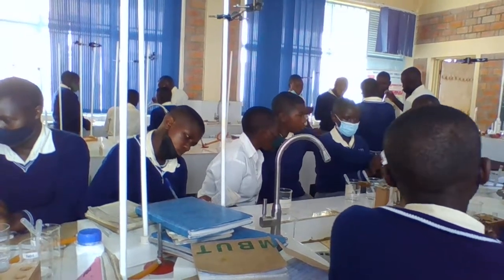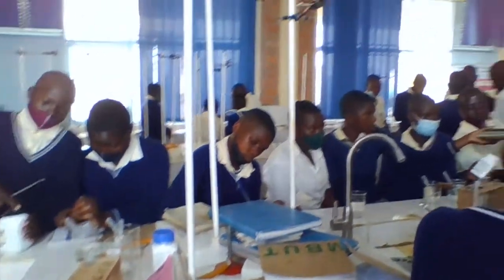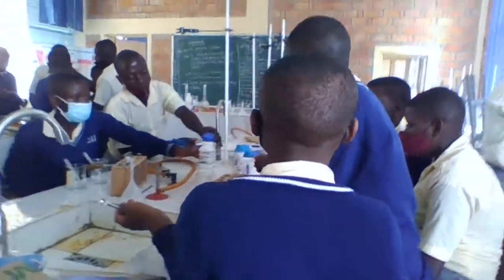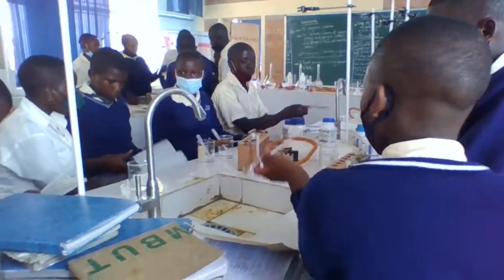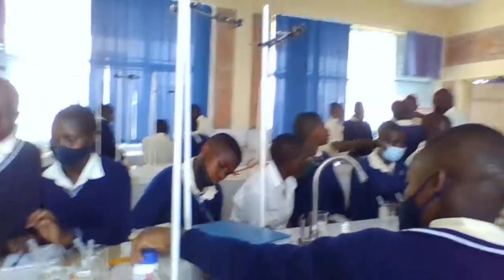And this also is needed to be used to close. You clean it and close. Use it to close. For this one. Is it from where?